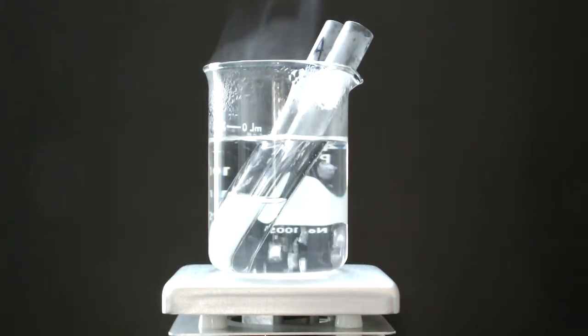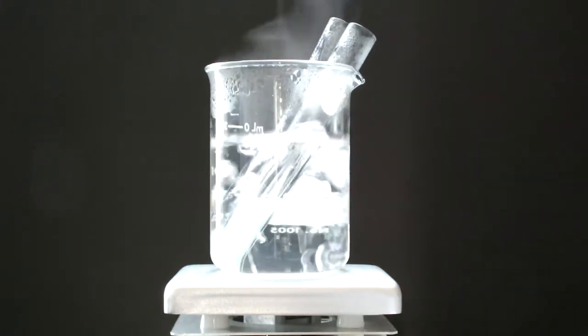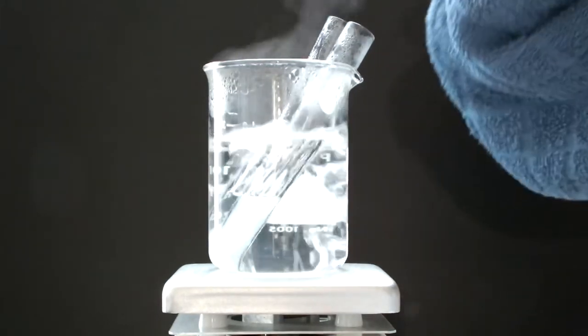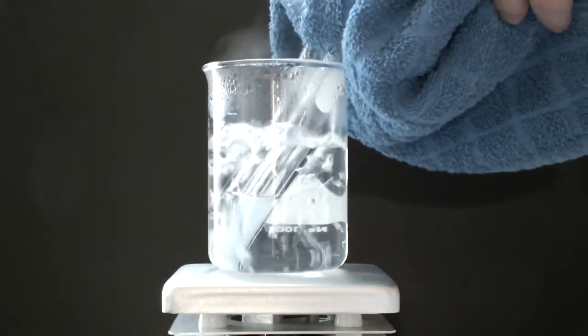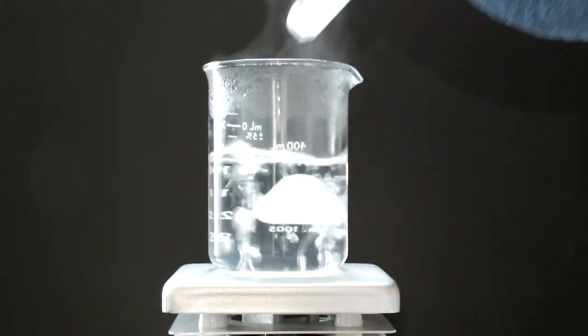Well, I got a gelatinous white precipitate as soon as I added the ammonia, and I got the precipitate after boiling without the ammonia. So, I don't get any of this either.